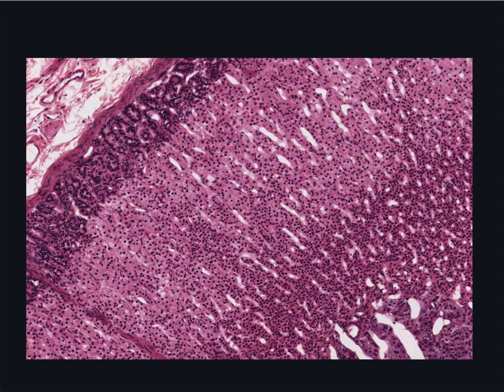One other feature of the vasculature is that medullary arterioles, also from the capsular branch of the suprarenal artery, run down the thickness of the cortex, all the way from the capsule into the medulla. You can see small transverse profiles of them in various locations in the cortex as they pass down to the medulla. They gain their name from the fact that they deliver fresh blood to the medulla. Thus, cells in the adrenal medulla have a direct arteriole supply instead of only relying on blood that the cortical cells have first received.